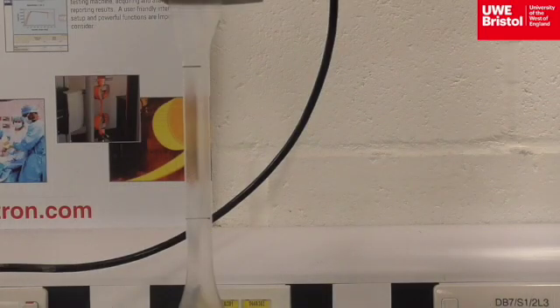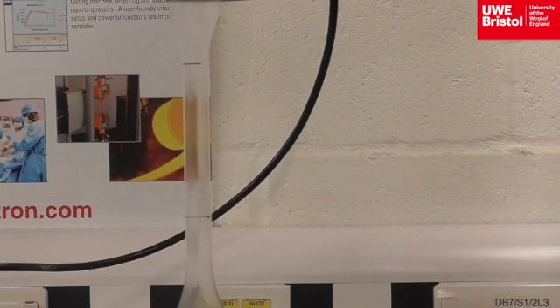Begin the test by pressing Start on the software screen. Observe the polymer closely for any changes in shape and color. The current rate of extension is 4 mm per minute, which is quite slow comparative to some other polymers.